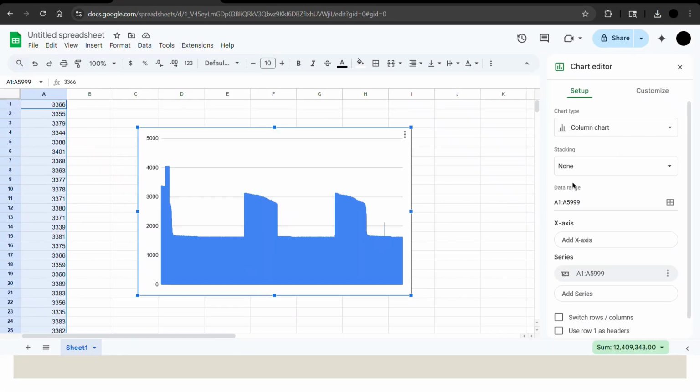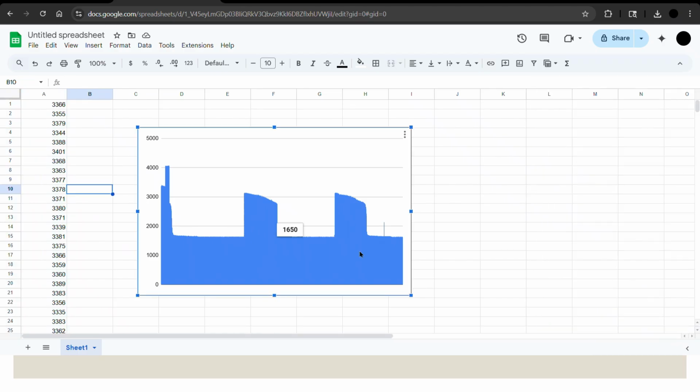Here we can see the loaded-in file where you have each of the integer pixels loaded into this column. We can see the first 6,000 here loaded into this graph, where you can see my finger placed along the center of the frame.